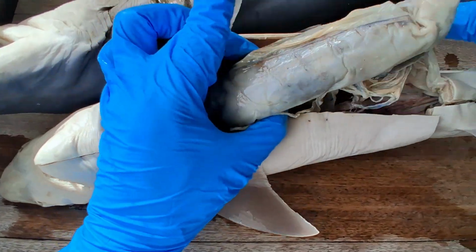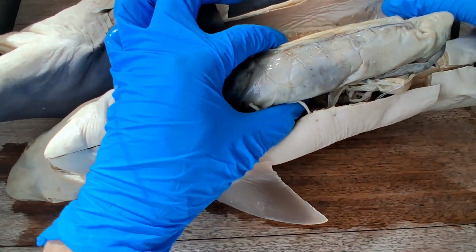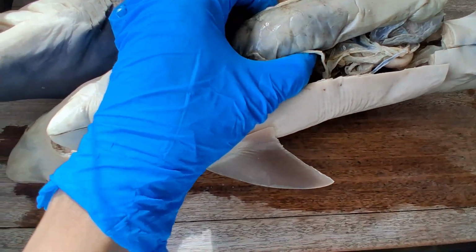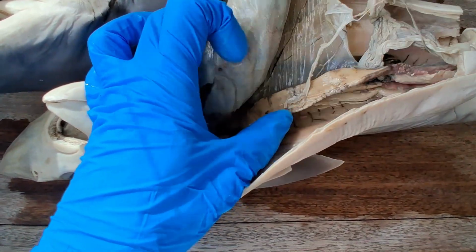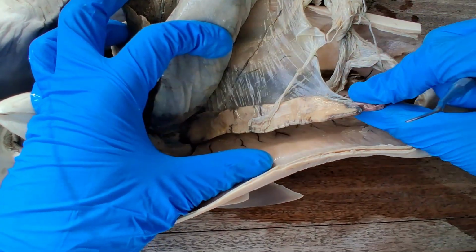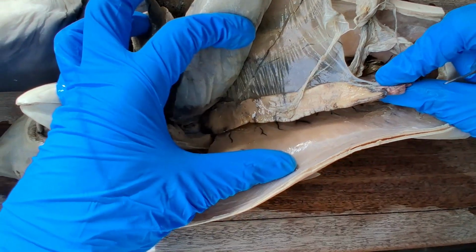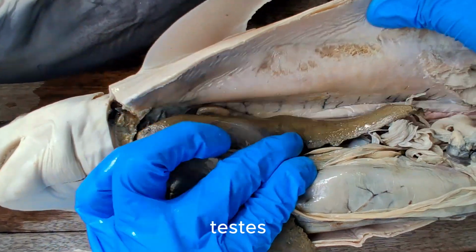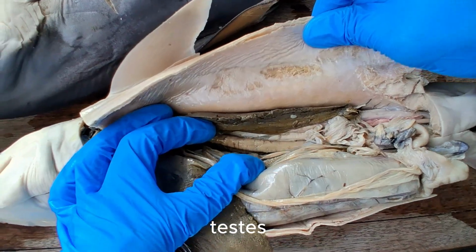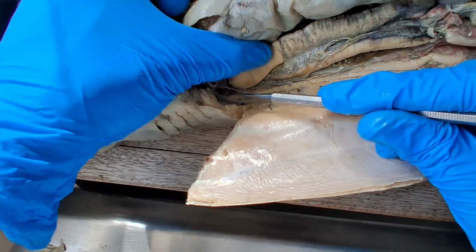So in this case, the stomach has occupied a significant portion of the pleuroperitoneal cavity. This huge white thing is its testes. So it's paired. Here's another testis there.